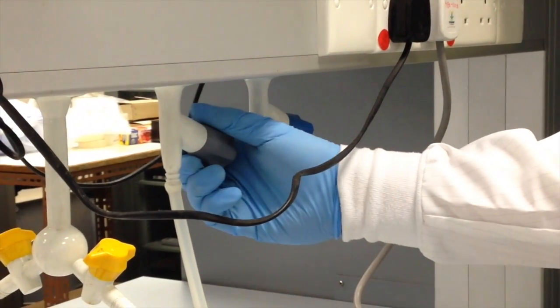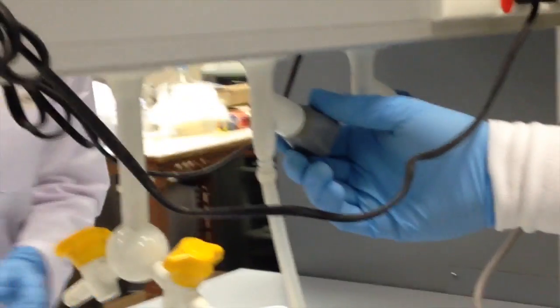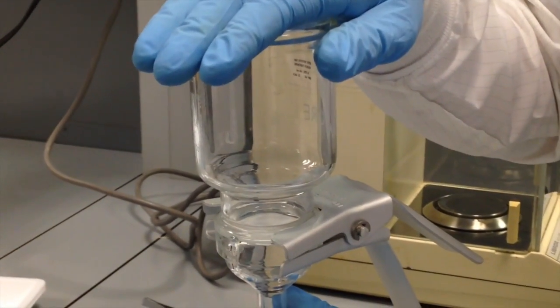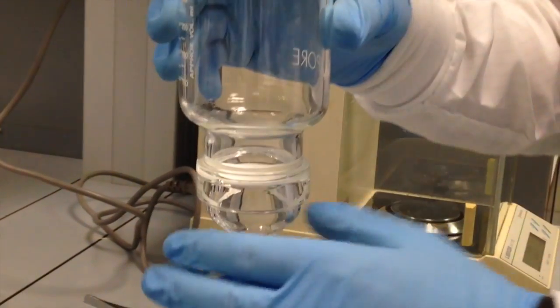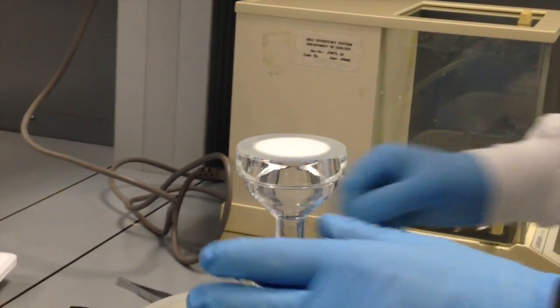So now I can turn on the vacuum, and you can hear it. You can hear the vacuum being applied. And it's simply going to be sucking air from the room into the vacuum system until I add some solution to this vessel. But I don't want to do that because I don't have a filter in place. So I'm going to turn the vacuum off. I'll remove the clamp and reverse the process, take off the funnel so that I can apply a filter.